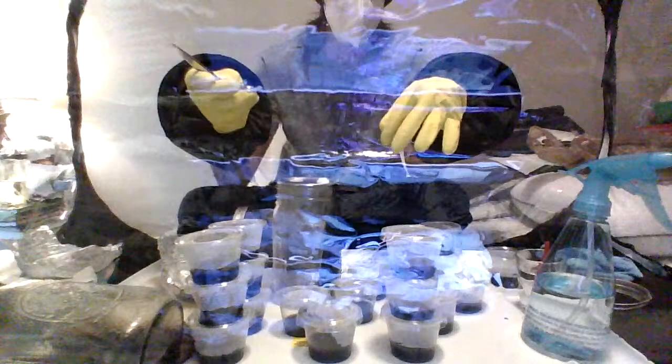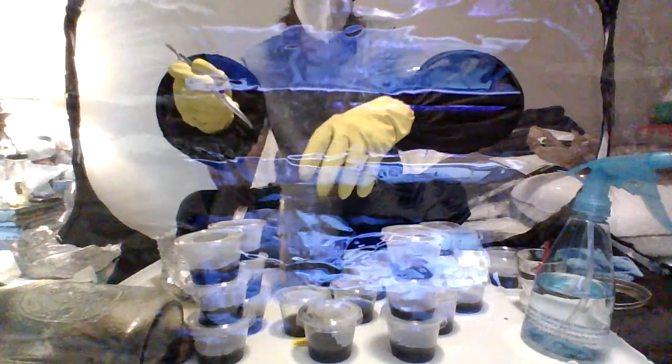You could wait until that grows before you do your trenching, but I feel like that's a risk. You're risking having to do this all over again, because if you let it grow and the bacteria happens to outrun the mycelium, then the trenching doesn't help. The bacteria has already made it from one end of the petri dish to the other. It's too late. You waited too long, right? So I like to do it right away, as soon as I put the sample in there. All right.